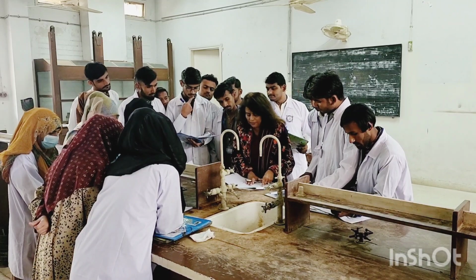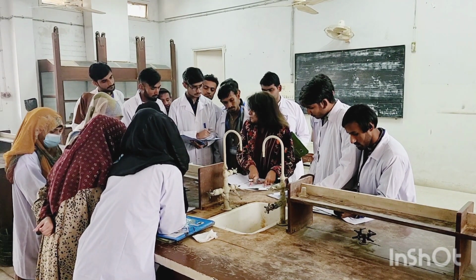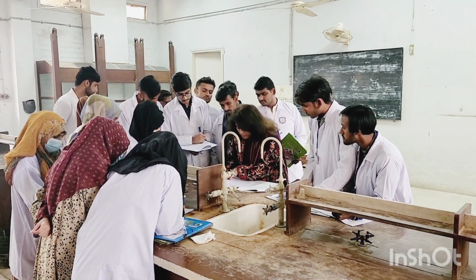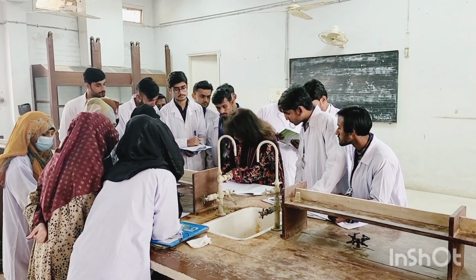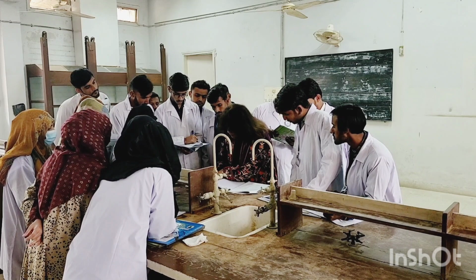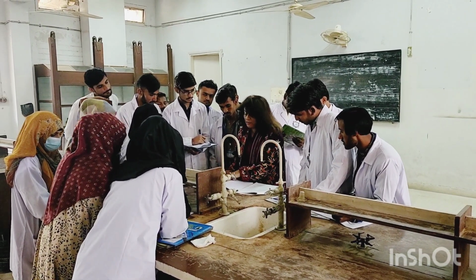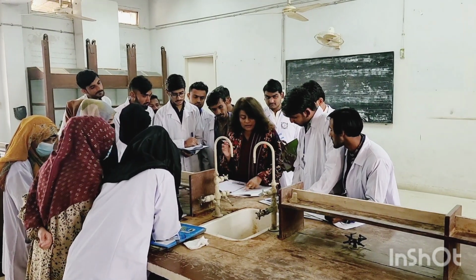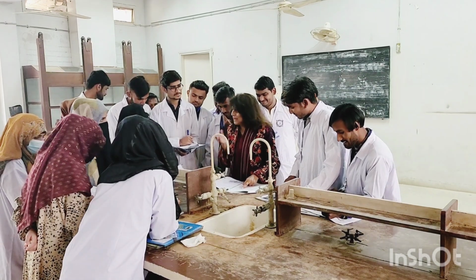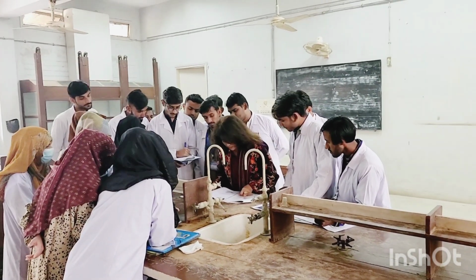So now here, they explain a few things. Read out these things. After that, you are going to make 3 columns, just like here. Experiment, observation, and inference or result, not interference. Inference or results. So you will write down here.